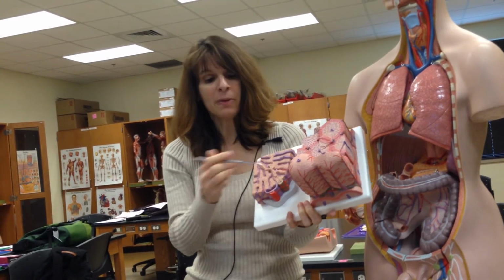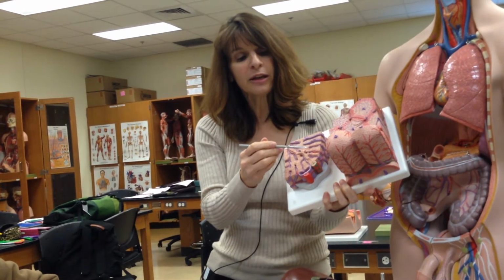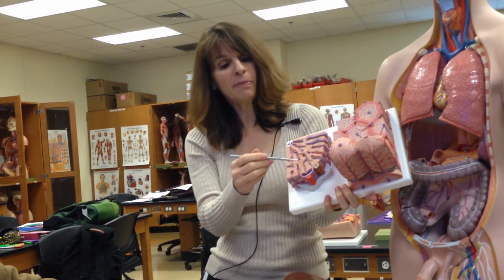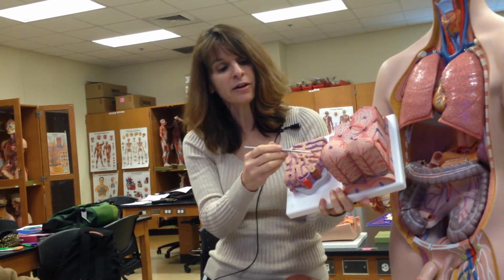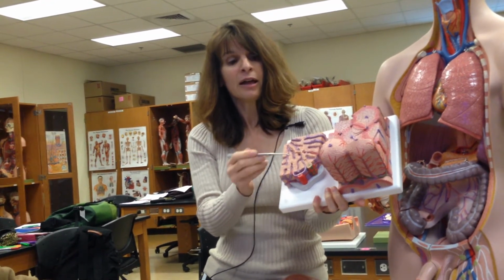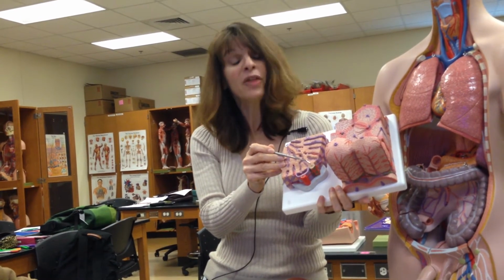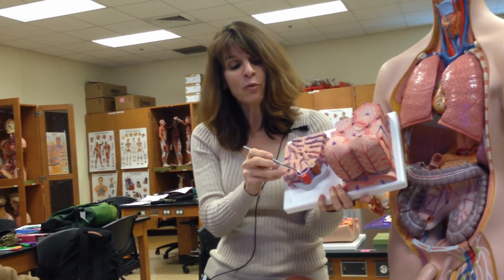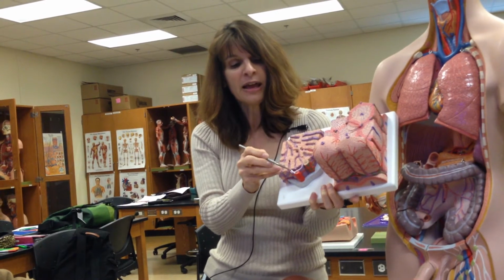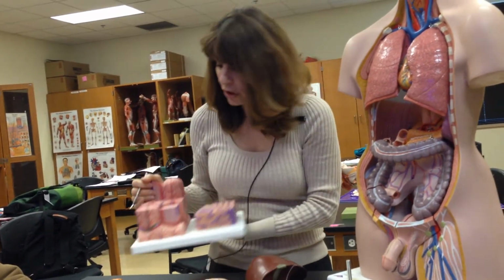And then here's a blow up. So see the purple central vein in the middle. What do I call these cells right here? That would be hepatocytes. What do I call these spaces here? Hepatic sinusoids. And then can you see the triad? What would this one be? A branch of the hepatic bile duct. What would this purple one be? A branch of the hepatic portal vein. And the red one? A branch of the hepatic artery.